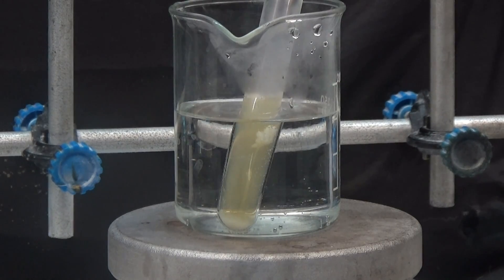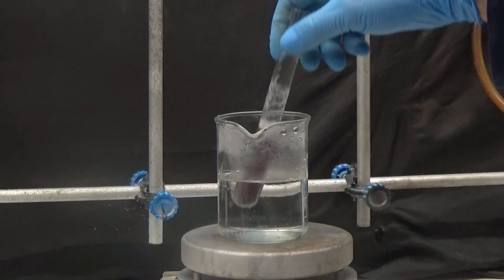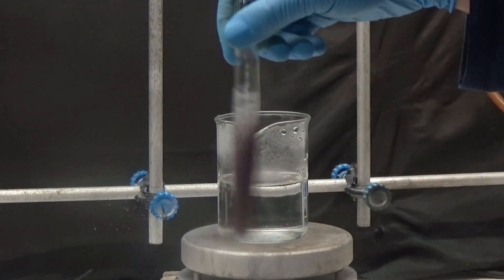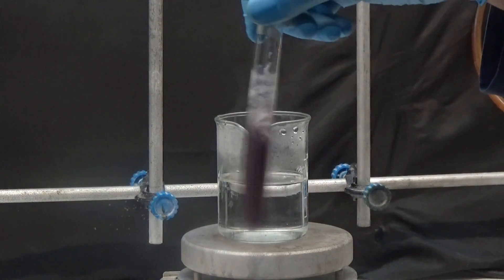The egg white coagulates first, as was observed. The heating continued and in the end, the result was positive for alpha amino acid, turning from yellow to intense violet.